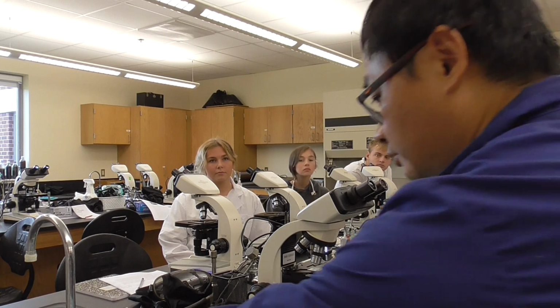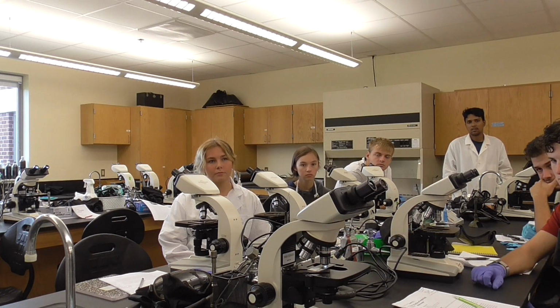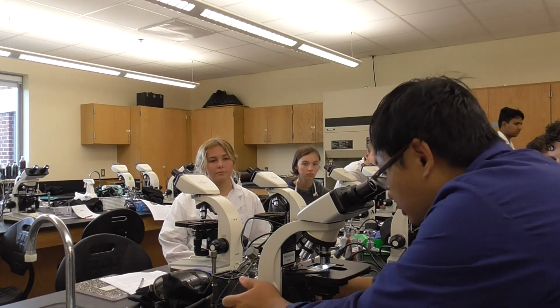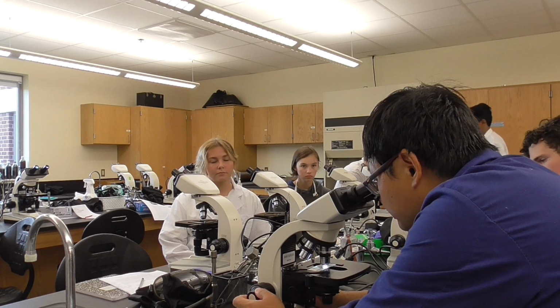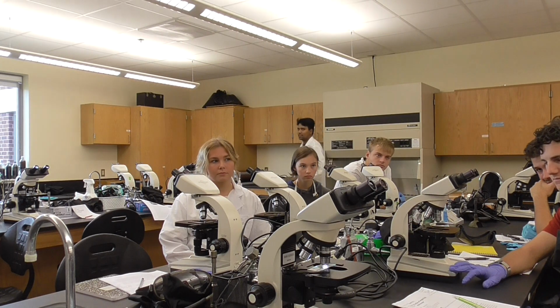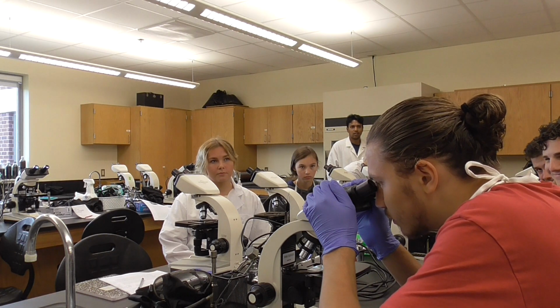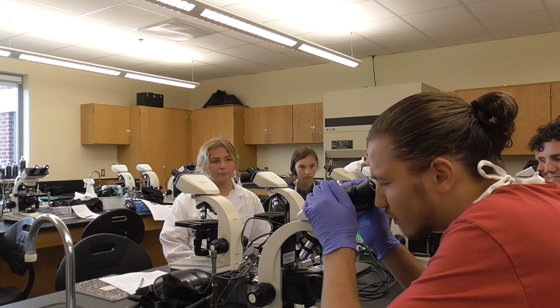When you put the oil there, then go to 100x. Now the iris diaphragm has to be adjusted to 100x. Then you only need to do a very tiny adjustment and you can see the morphology. Go ahead to see it. You will see it looks like a grape and is stained purple. It's a coccus, a round shape, because it is Staphylococcus aureus.